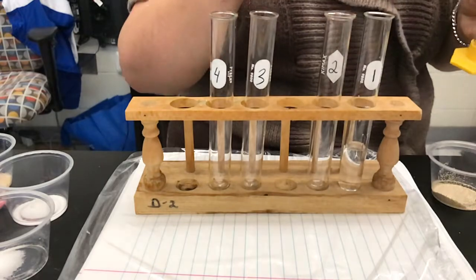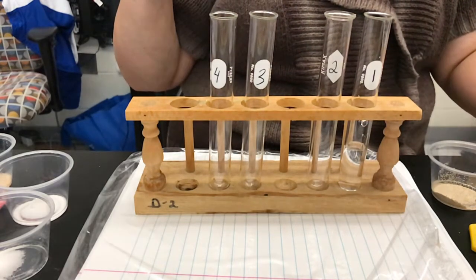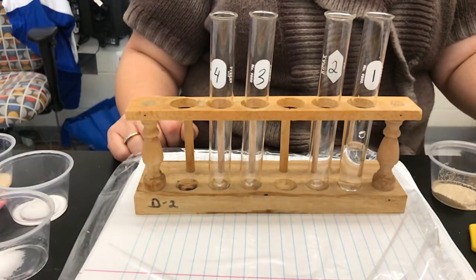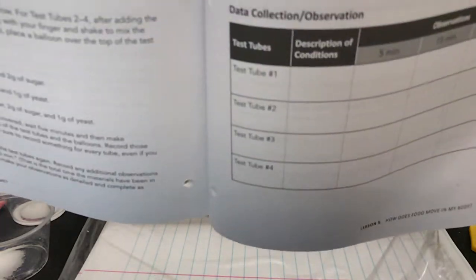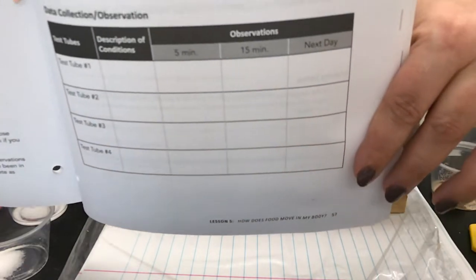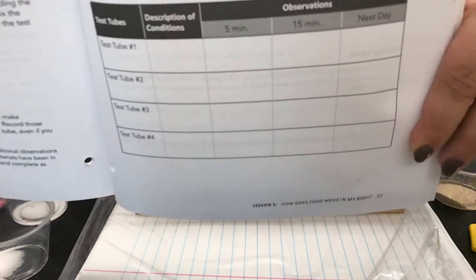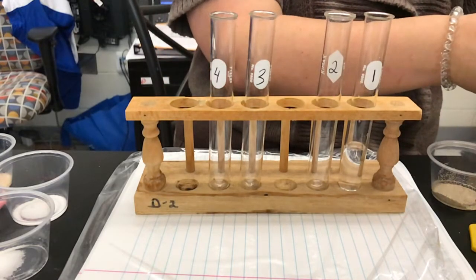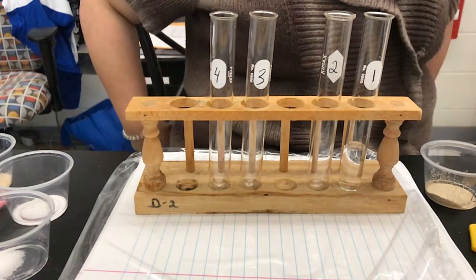That's a little drop. If you scroll further down, you have a chart — it says data collection and observation. Scroll down for test tube number one, where it says description of conditions. Under description of conditions for test tube number one, you are going to put 10 ml water.